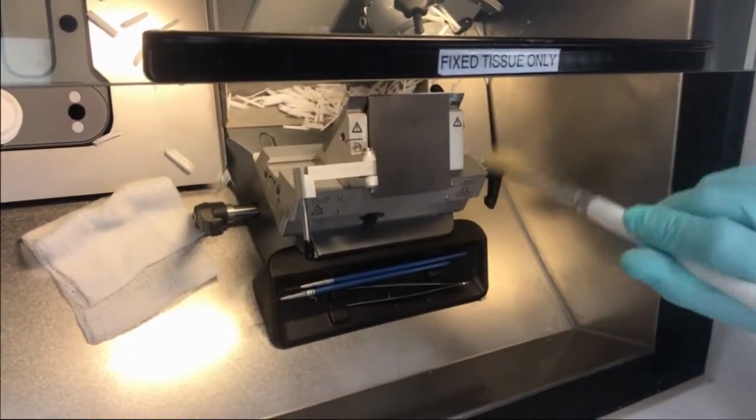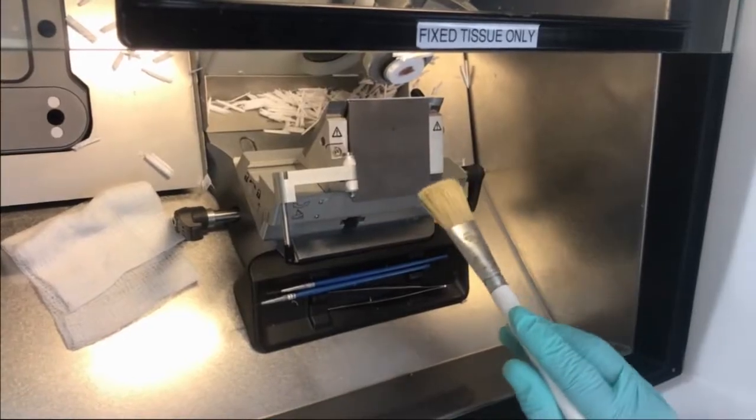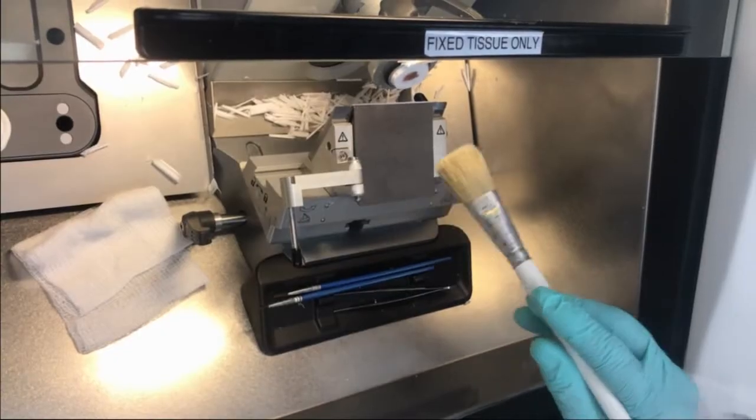So we brush away from the sharp edge. Because if you brush this way, you're going to dull the blade. Okay, you're going to put a nick in the knife and you're going to dull the blade.